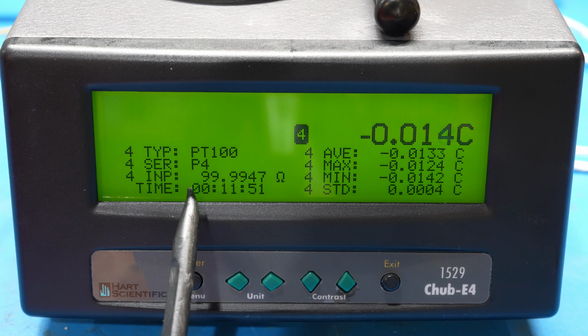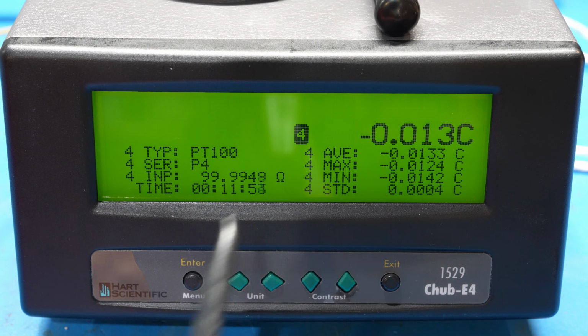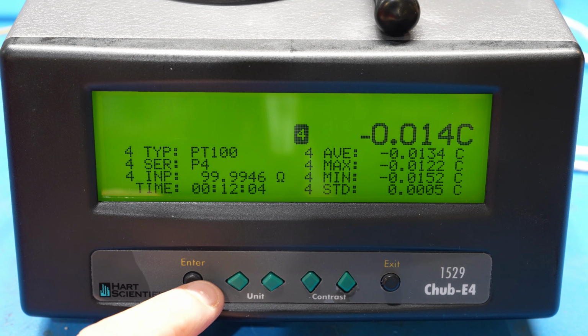And check it out, 99.9948 ohms. Not too bad. That's actually very close to where that resistor is supposed to be. So it is doing a pretty good precision resistance measurement. Now, because we're getting good data from all the channels, it is most likely working.